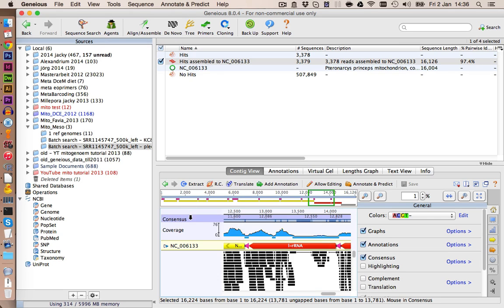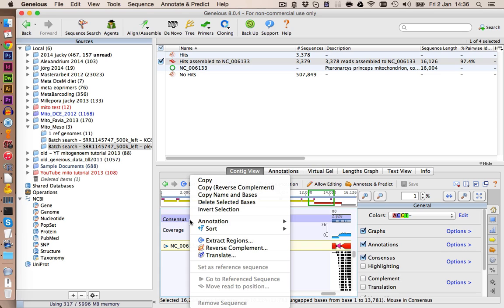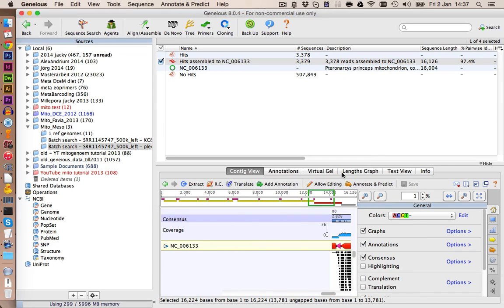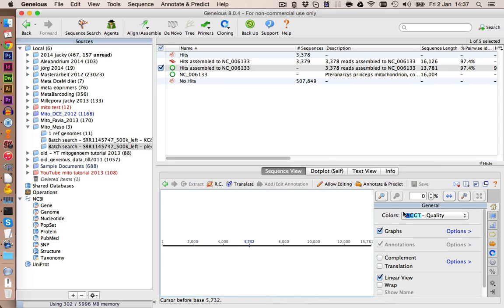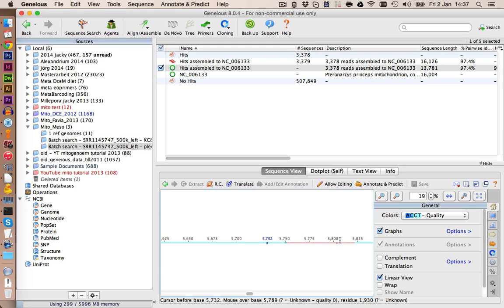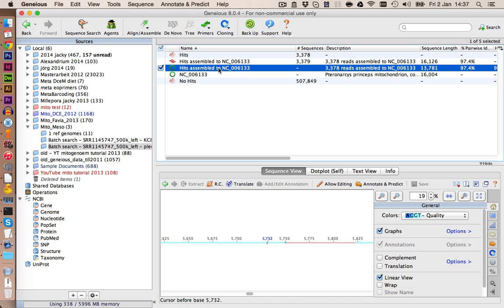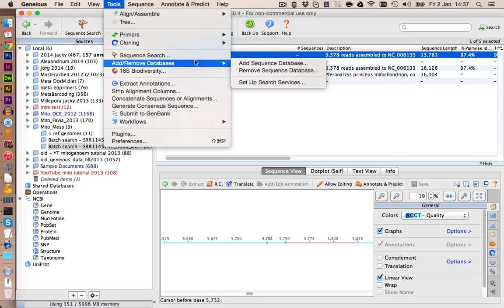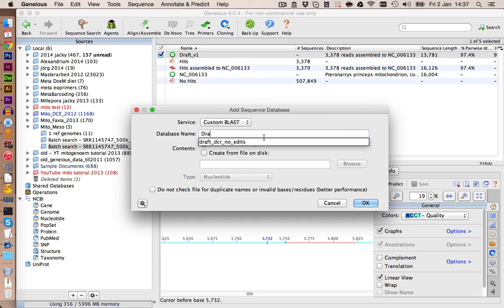So let's right click and we click on extract regions. And here we have the consensus sequence. You notice we have also some gaps in here, but we don't mind that right now. And we're going to change the name to Draft_v1. Let's add this one to the sequence database. And we call this Draft_v1.